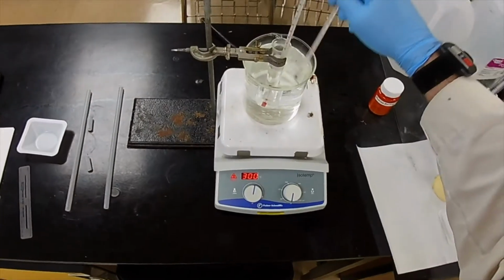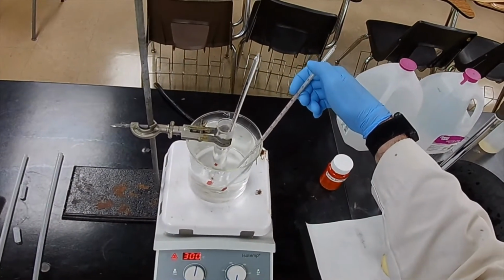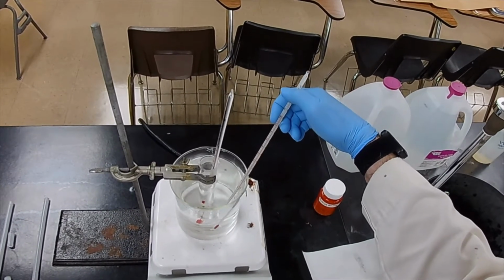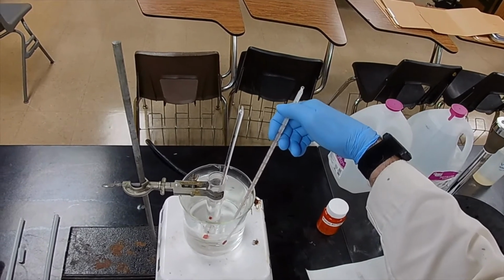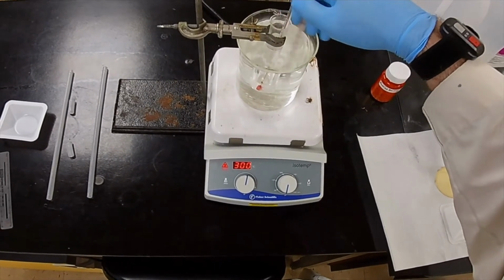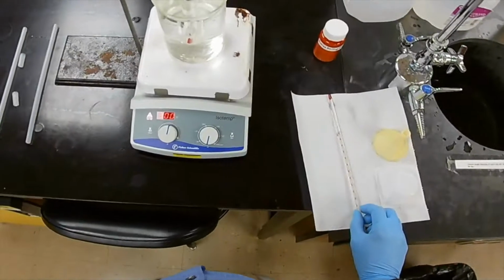So let's see what the water temperature is. Just out of curiosity. This is not a data point. This is just to satisfy my curiosity. Okay, water temperature is passing 80 degrees, on its way. 83.5. Okay. So before long, that water is going to be boiling. And that's not a problem. We only need it to be hot enough to melt the solids in our tube.